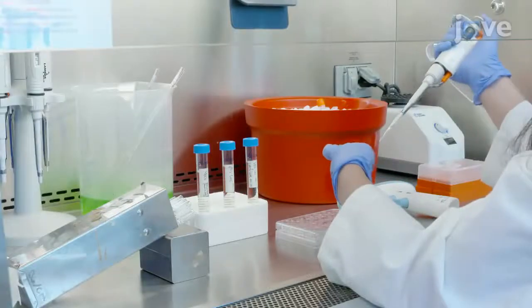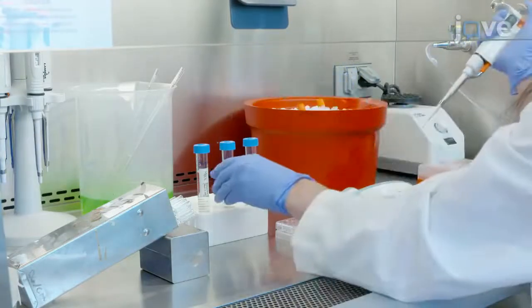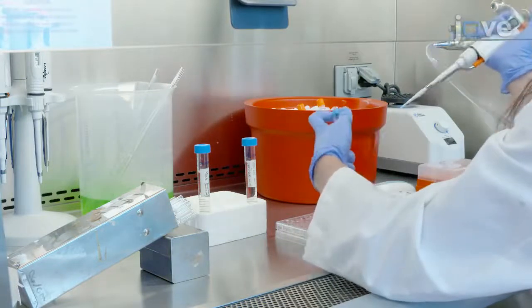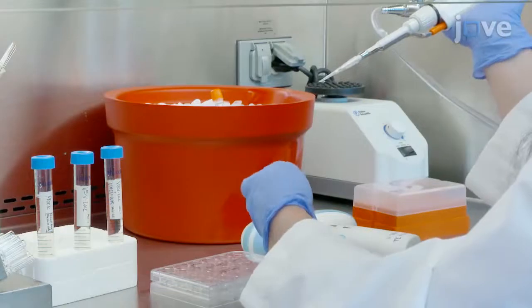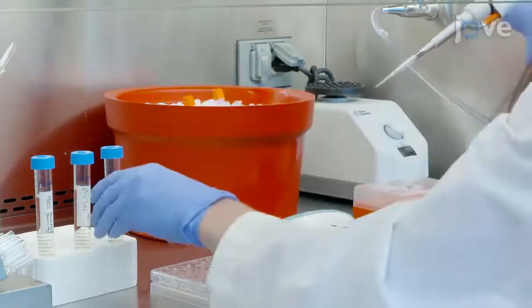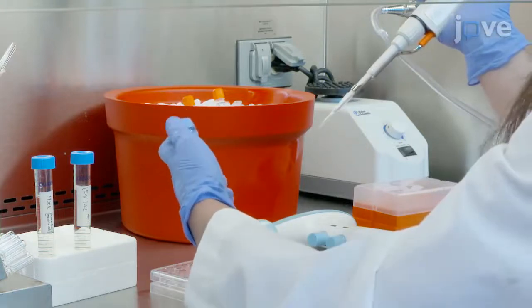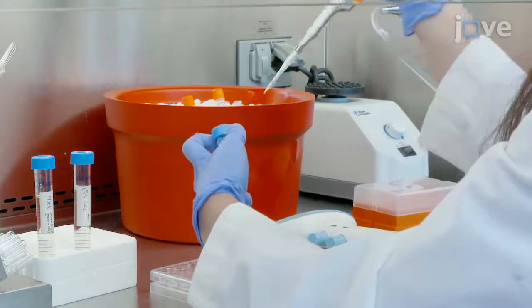30 minutes prior to the infection, thaw stocks of VSV luciferase and vaccinia virus on ice. Then, dilute VSV luciferase with and without vaccinia virus into SFM such that an MOI of 10 and 25, respectively, is achieved.